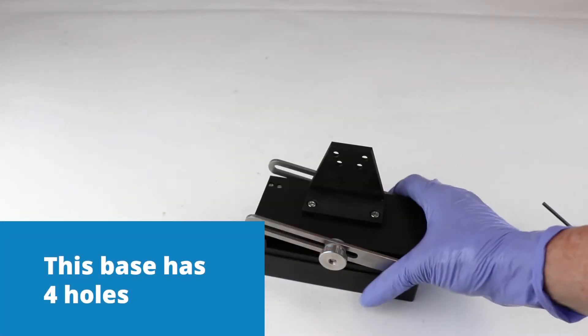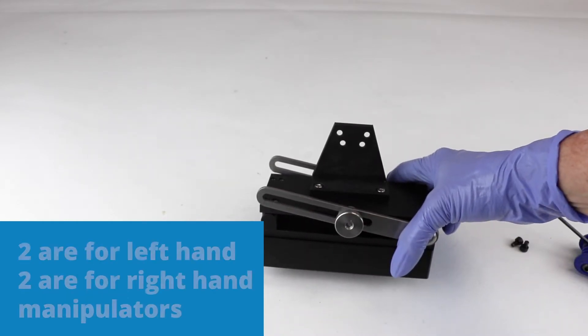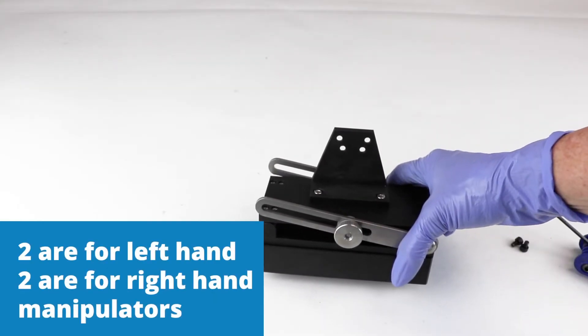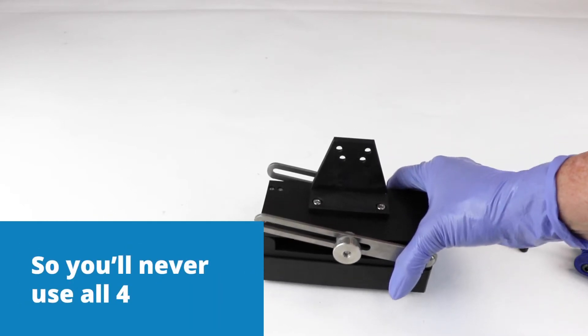You'll notice that this base has four holes in it. Two are for left-hand and two are for right-hand manipulators. So you're never going to use all four.